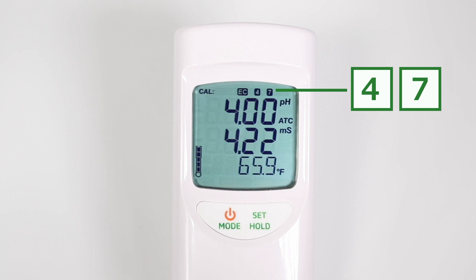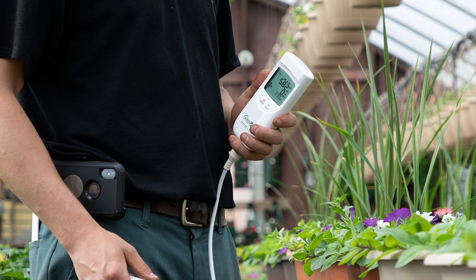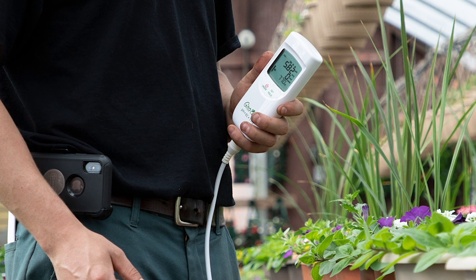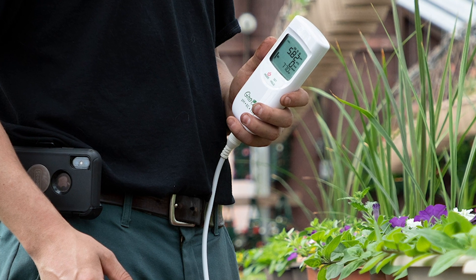These icons do not act as calibration reminders. They remain until the calibration is cleared or you perform a different type of calibration. Depending on the frequency of use, it is recommended to calibrate the pH probe daily, weekly, or monthly. Generally, commercial growers calibrate daily while home growers calibrate weekly or monthly.